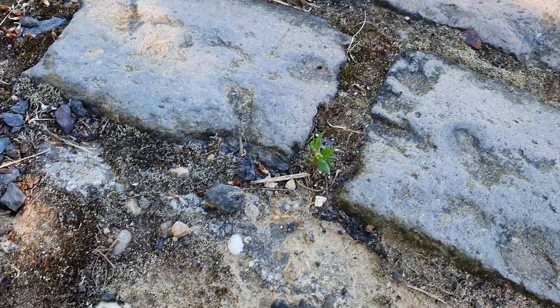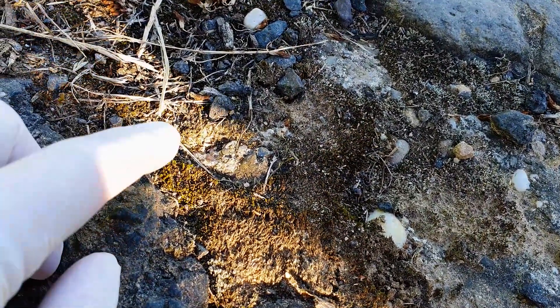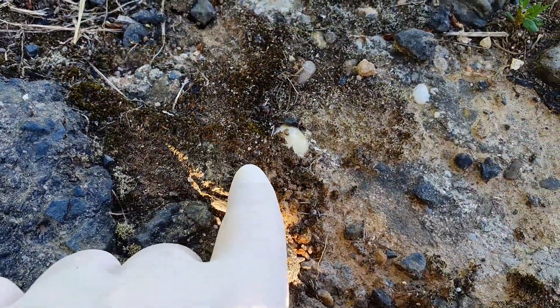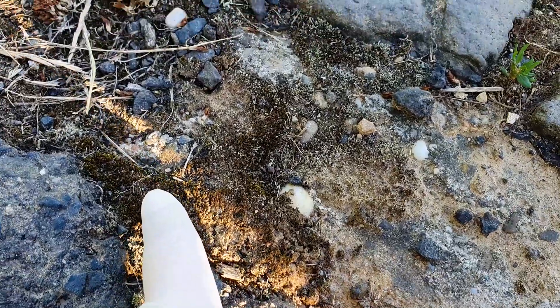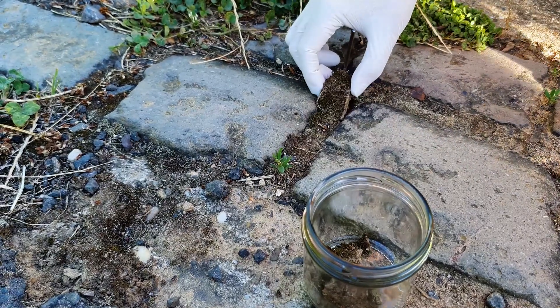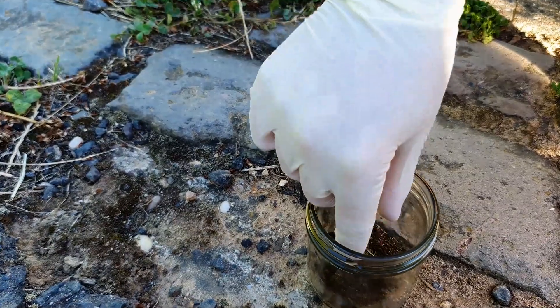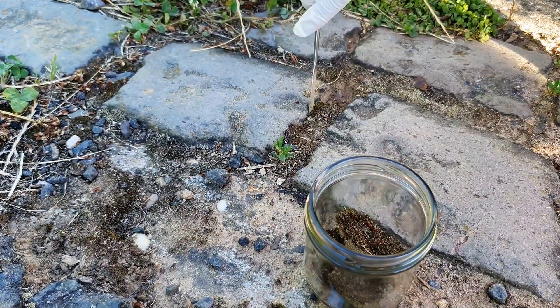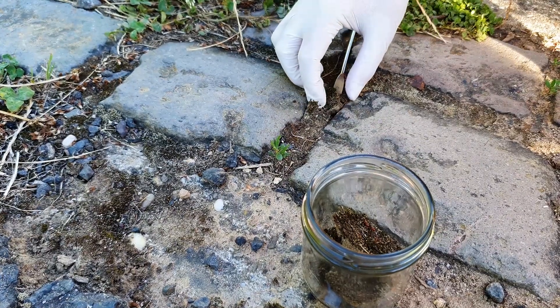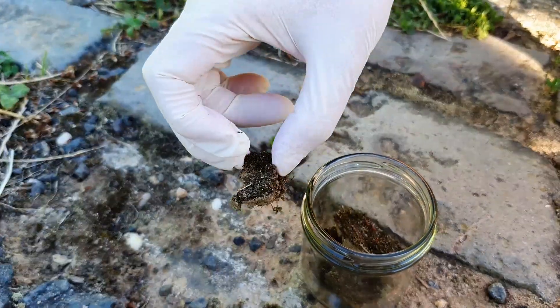I went outside to collect some of that street moss and this is what it looks like. It seems pretty parched and dry since it hasn't rained in a while here where I live. I collected this moss together with the soil in which it is attached and put it in a jar. Once home, I soaked half of it in tap water to bring back to life any aquatic microorganisms that might be living in it. But first, let's take a look at the parched moss under the microscope.